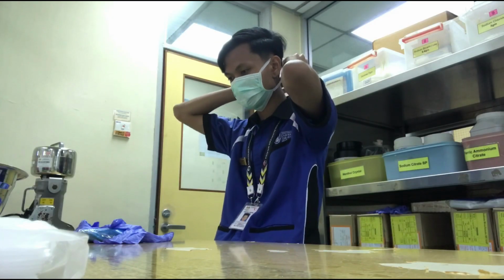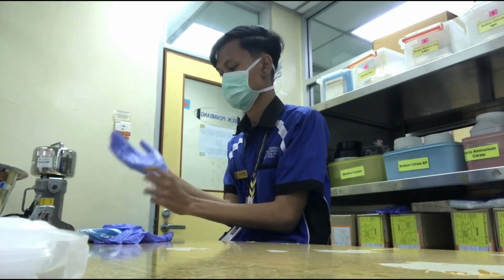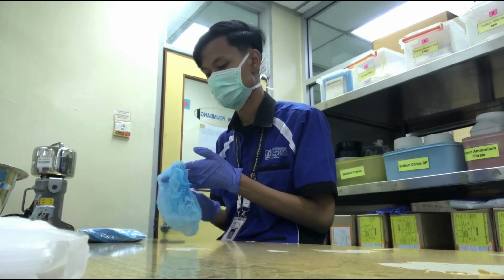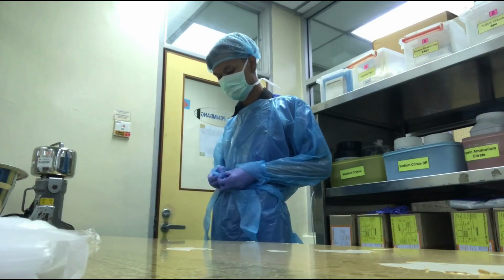Hello everyone. In this video, I would like to share the essential procedure when preparing medication in the galenical department. I will show some of the important techniques with a few examples.